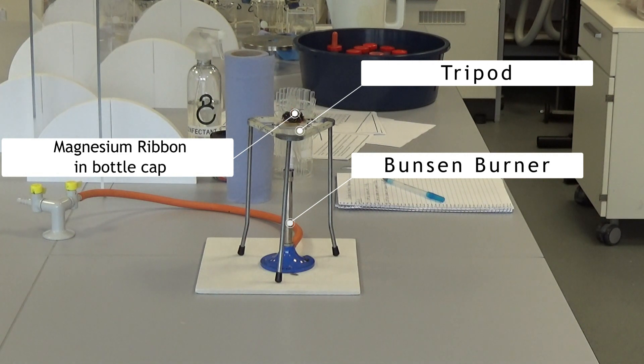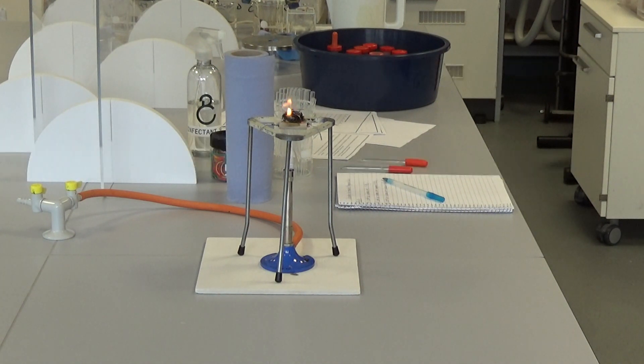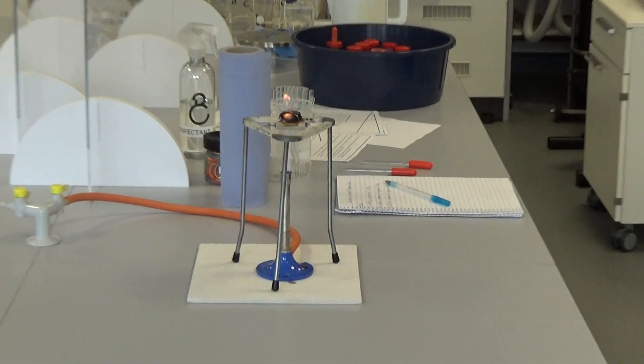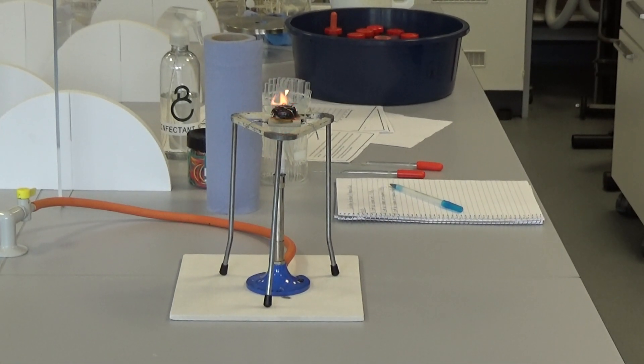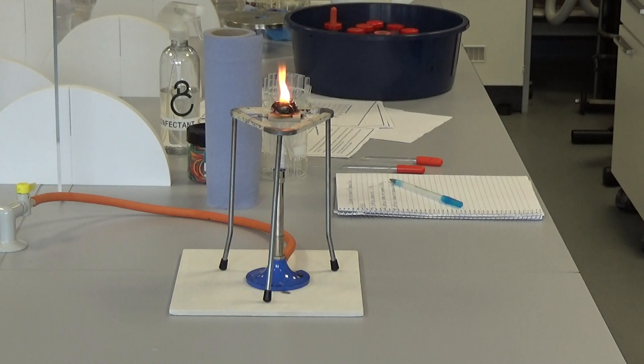We should see the magnesium light as it reacts with the oxygen in the air. We'll possibly see the glow through the bottle tops. It probably will go bright at some point as the magnesium catches fire.